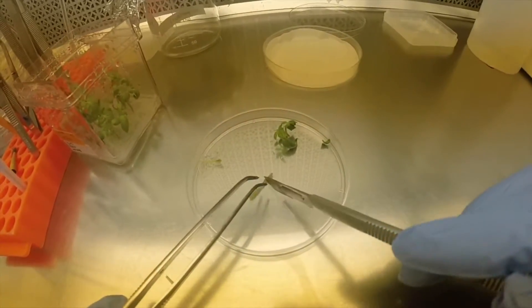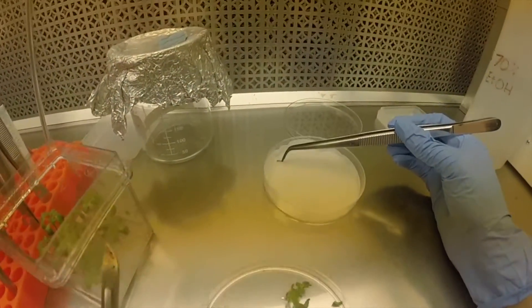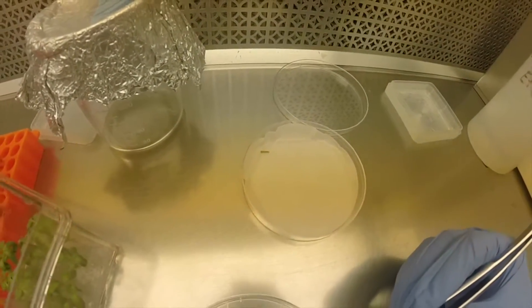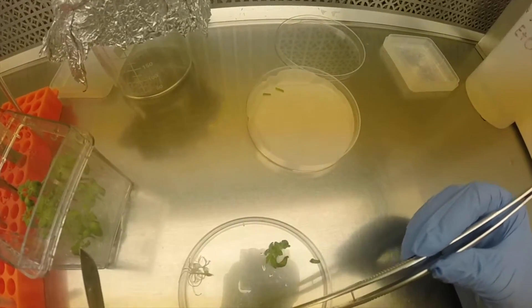We're going to cut this into small pieces and immediately transfer them to the media so they do not dry out. All this is being done using proper sterile technique.